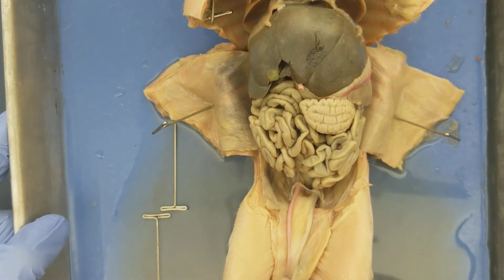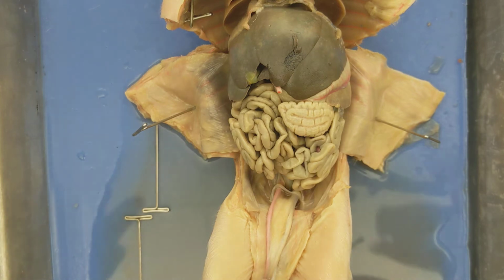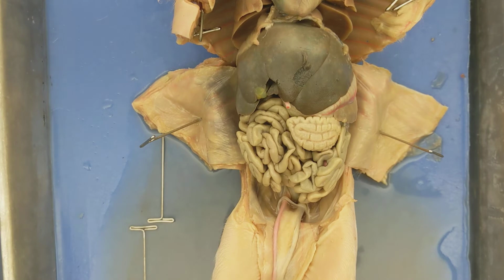There are a lot of organs associated with the abdominal cavity of the fetal pig, much like us as humans. You'll find organs that are part of the digestive system, organs that are part of the reproductive system, organs that are part of the urinary system. Also, as we look through the abdominal cavity, you'll notice some organs are readily apparent on the surface. There are other organs that we have to dig a little deeper in order to see. So I'm going to start with the surface level organs that you can see readily on the surface of our fetal pig here.